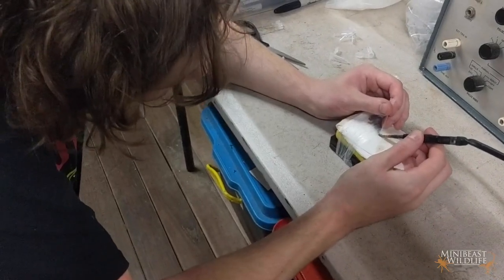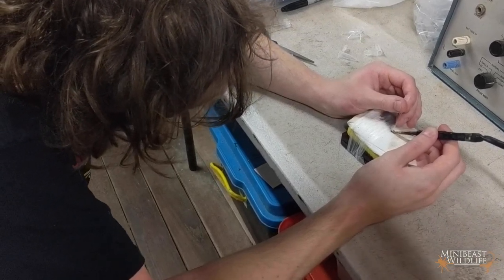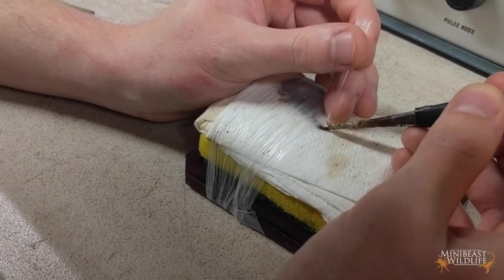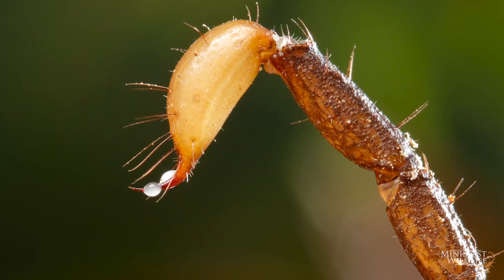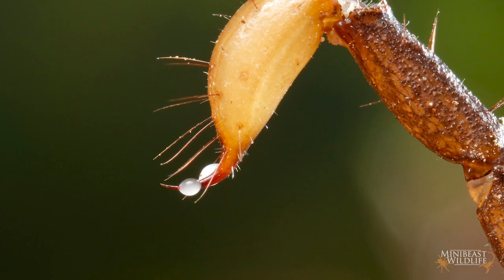You won't be able to see from there, but there's a small amount of venom starting to be expelled into the tip. I can see it if I put my finger next to it — yeah, I can see the white. I'm a venom-spotting professional as of 30 seconds ago. Fun tidbit: most venoms are transparent, but scorpion venom is white and opaque, so at least the researchers can see what they're working with.